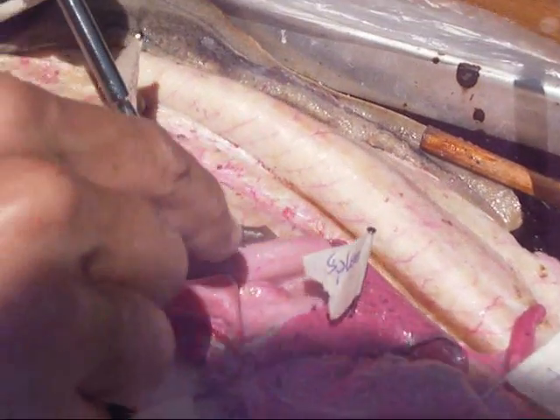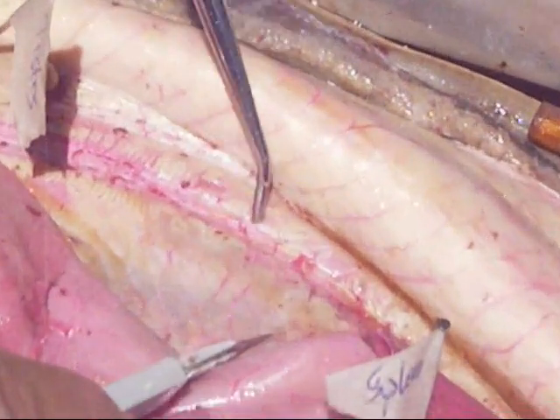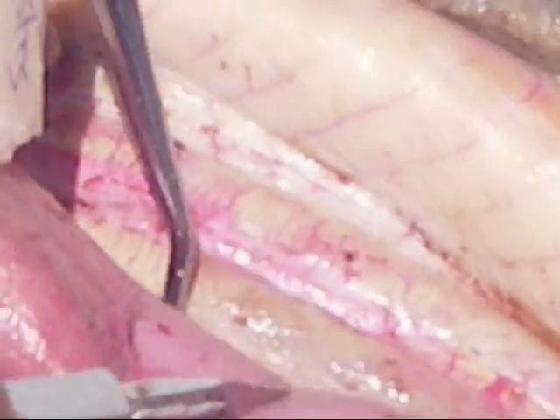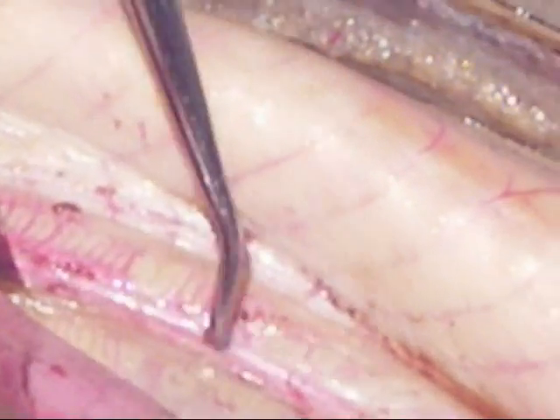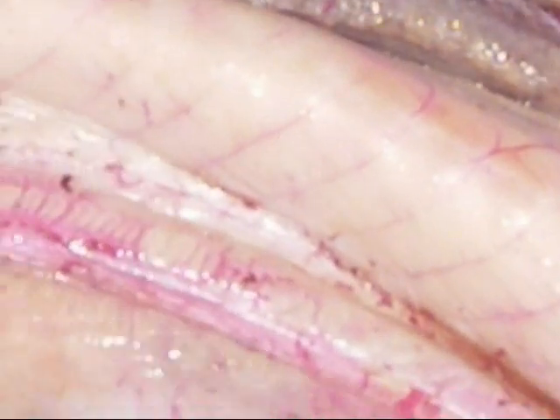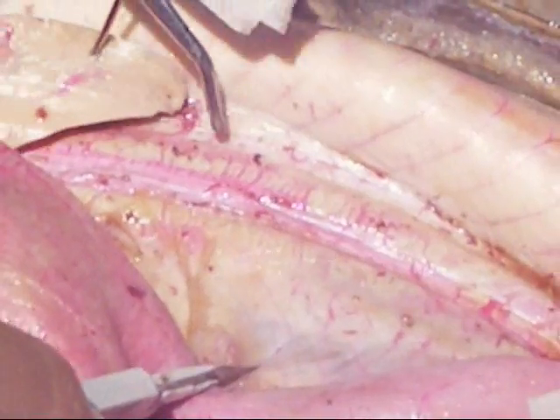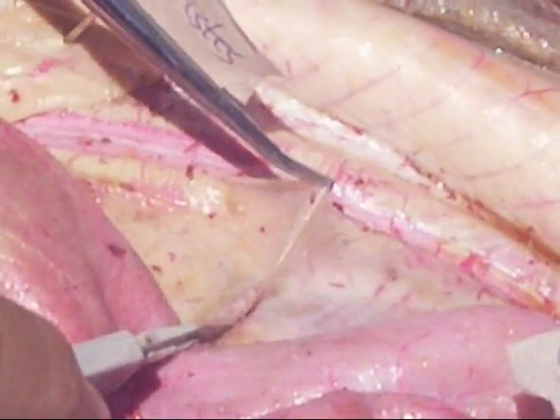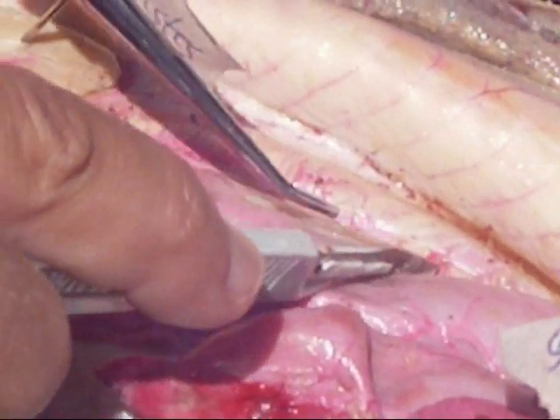The kidney — in the back. See these little tubes? That's the kidney? Wait, is the kidney with another lining? The back. Wait, that whole thing is the kidney? Well, you can't even really see the kidneys, but they're tubules underneath these. I think these are the male reproductive parts. It's the skin.